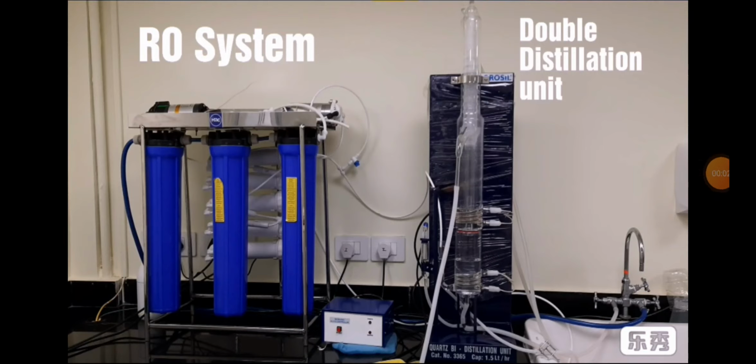Hello friends, today in this video we are going to show you how a water distillation plant works. At first we have to know what distillation is. Distillation is a water purification process by which we can purify water from solid particles.